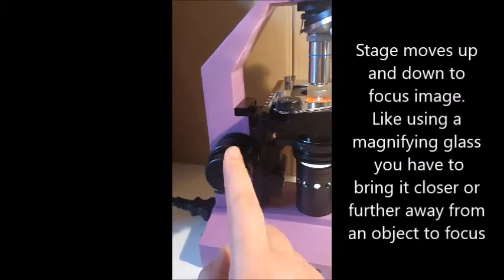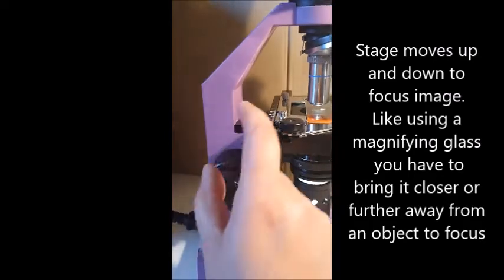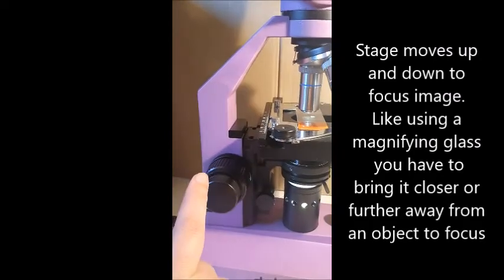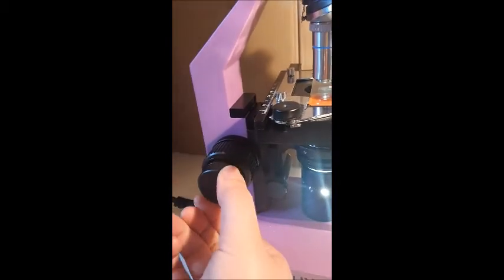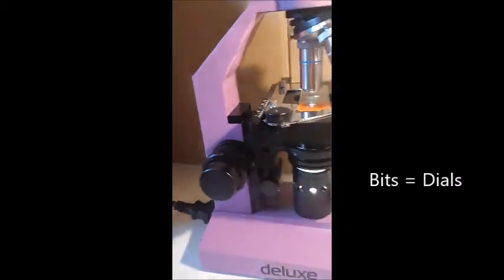So sometimes on some microscopes, you might have 2 knobs. You might have a big one for coarse and a smaller one for fine. This one is all in the one section, but there are 2 separate bits that you can turn.